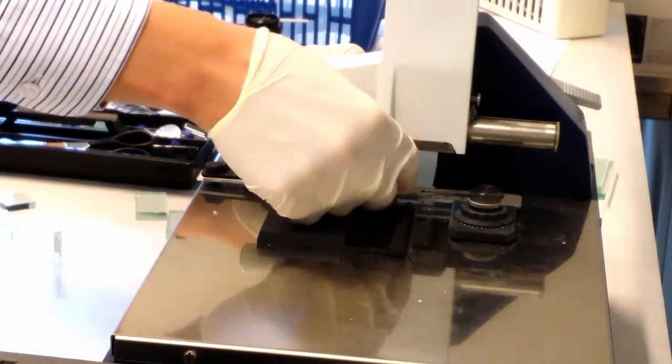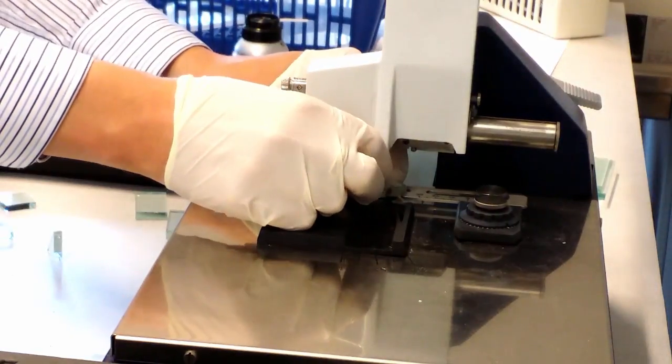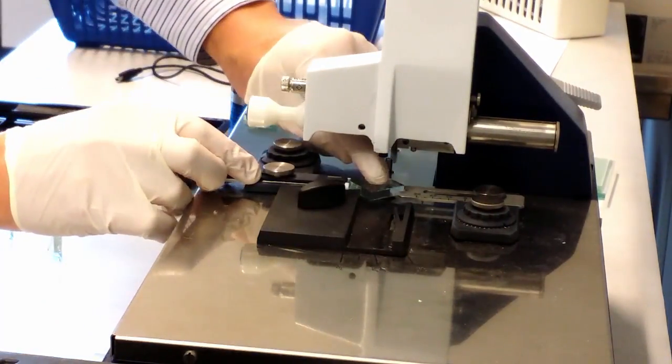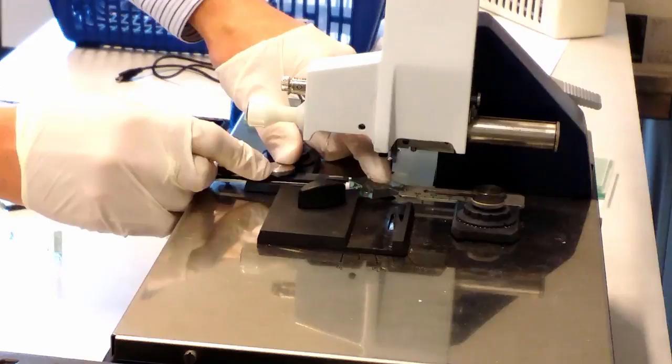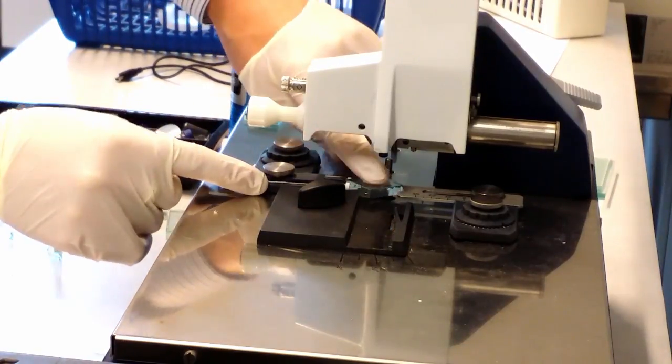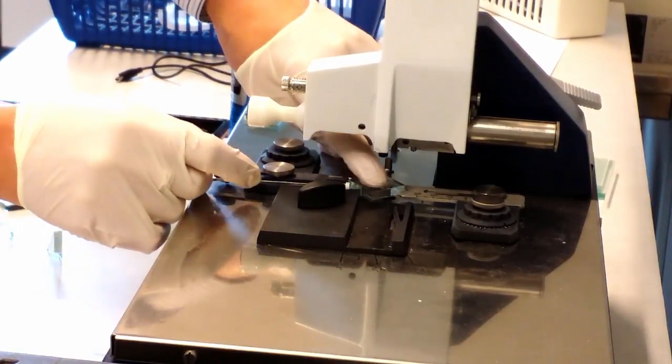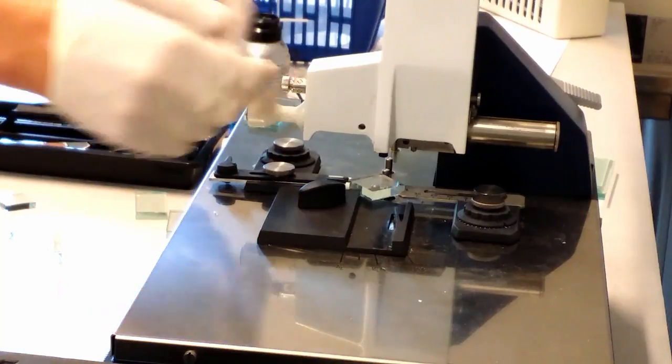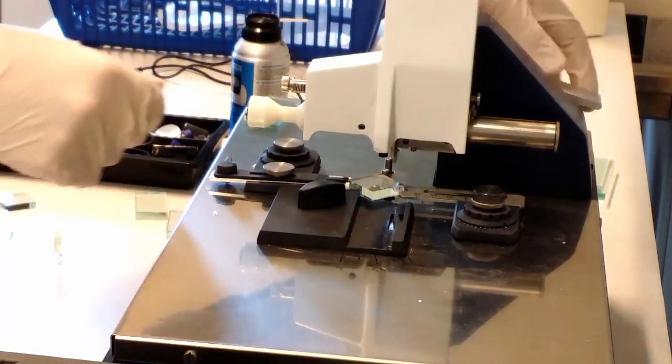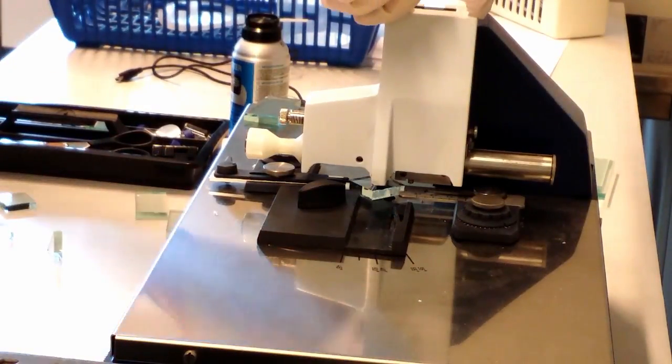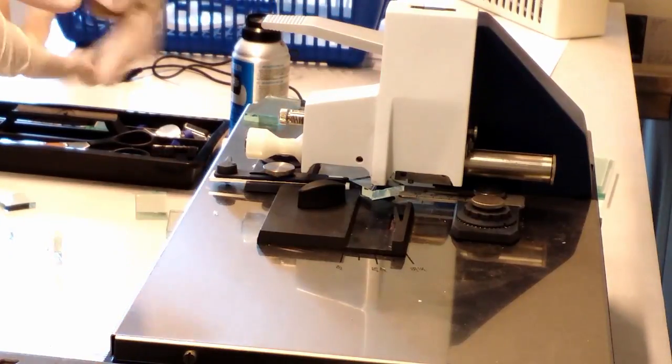Then you start with a long glass rod. This glass rod has already been cut several times, but after a while you achieve this. Then you cut this glass piece with the machine and divide it in half. So then you get even smaller pieces. And then again you divide this in half, and then you end up with square pieces like this. These ones you crack in the middle, and that creates these triangles.